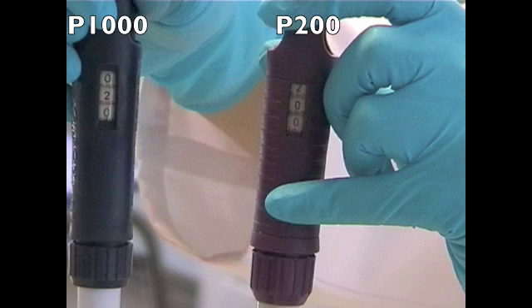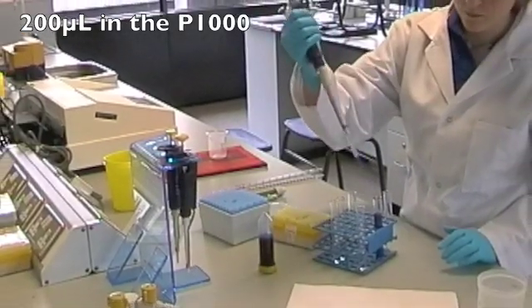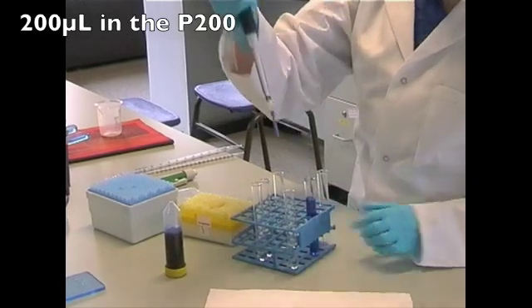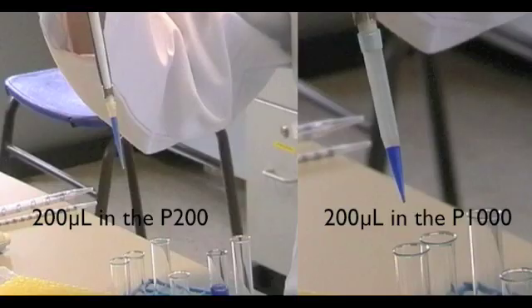Using the P1000 and P200 to measure 200 microliters, you will see that in the P1000, 200 microliters only fills 1/5 of the blue tip, while in the P200, 200 microliters fills the yellow tip to maximum capacity. Keep this in mind when you are conducting an experiment, as it will help avoid inaccurate pipetting.